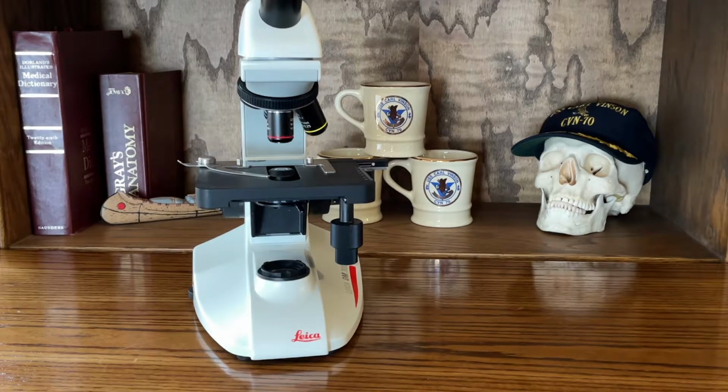Toward the latter end of this video, I'll show you the very fundamental way to use the microscope, making it the easiest for you to obtain the tissue sample in your field of view, and then ultimately zoom in on that tissue sample to find exactly what you're looking for.